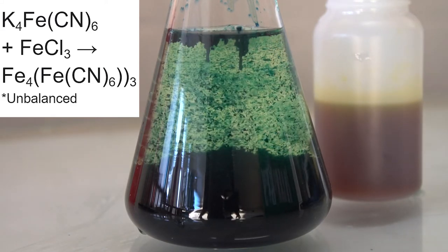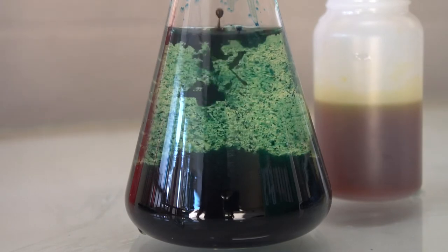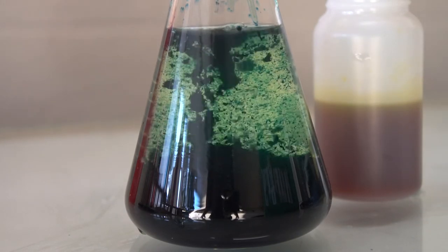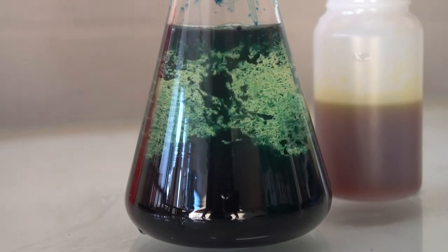The precipitate is very heavy and mushy and you'll want to filter it through a coffee filter as it has been known to clog filter paper.